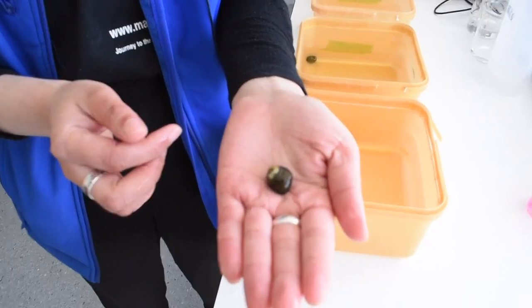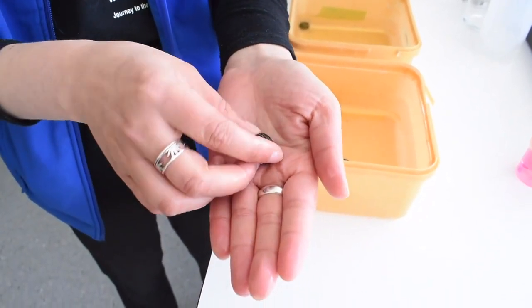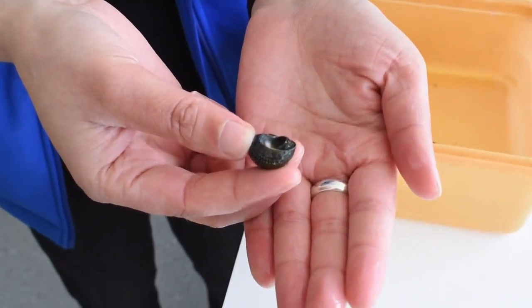Today we'll be using the maihi, or the spotted top shell snail, which can be found along rocky shores all around Aotearoa, and we will be doing 4 different treatments and seeing the response of the turnover time for these animals. Here is a close-up of our study animal today, the maihi, or the spotted top shell snail.